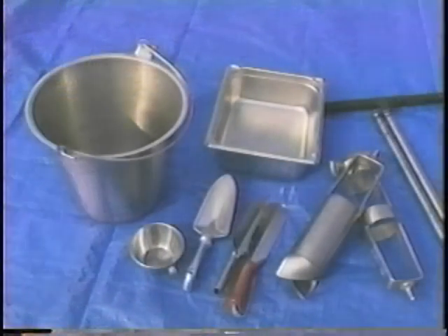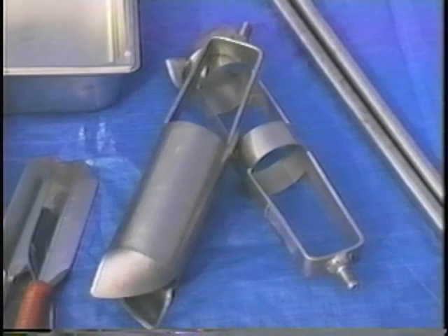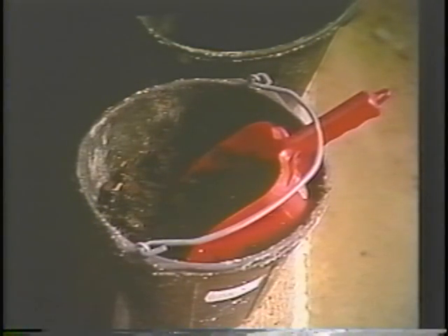Next, gather all the sampling equipment and sample containers that you might need. In general, your equipment will include stainless steel buckets, trowels, scoops, and pitchers. You may also need an auger for collecting samples of sludge from bins, compost piles, drying beds, and stockpiles. Stainless steel is generally acceptable for any sampling. If you're concerned about metal contamination, then use plastic equipment. Remember, plastic equipment may not be used to collect samples for organic pollutant analysis.